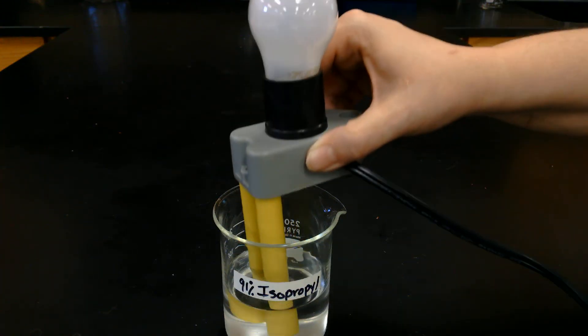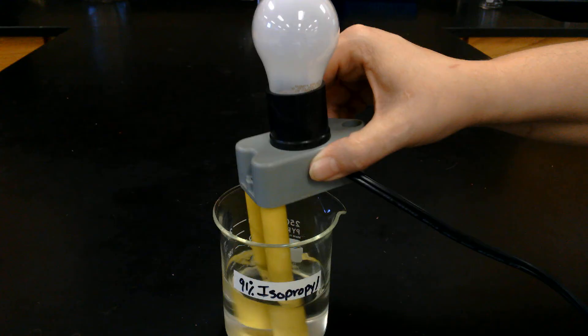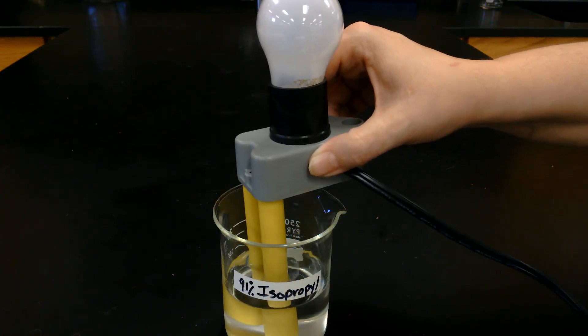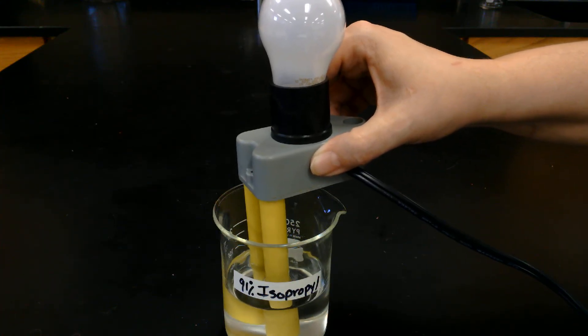Now we're going to try some isopropyl alcohol. Go ahead and make your observations.